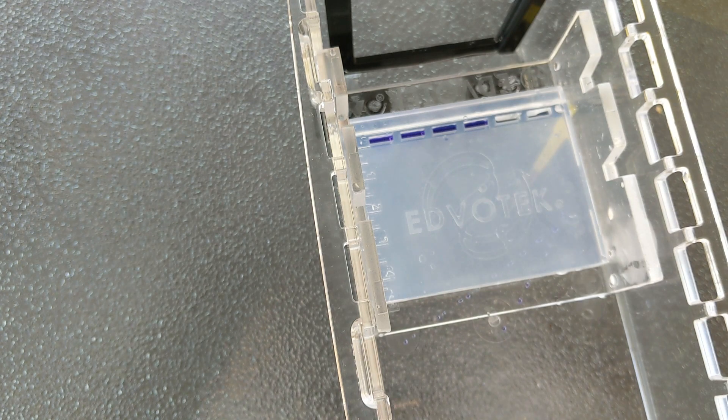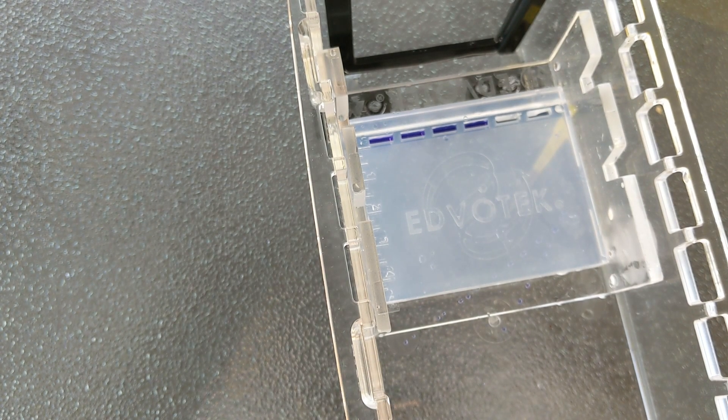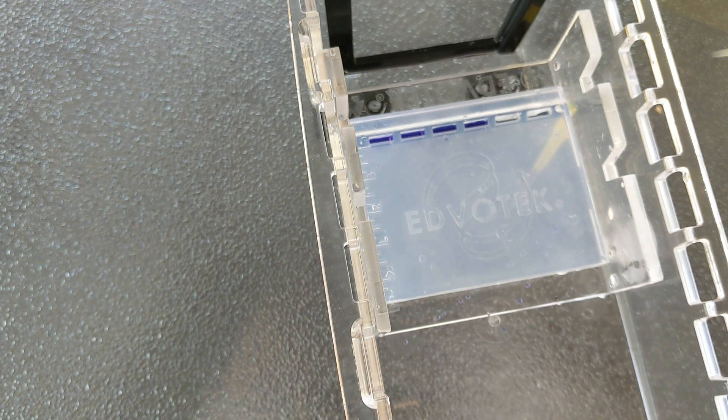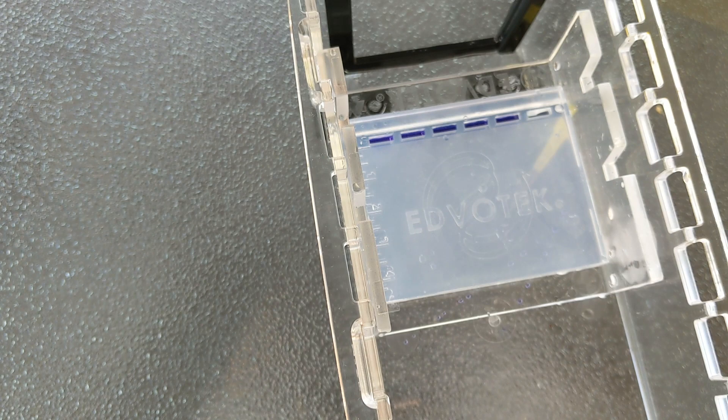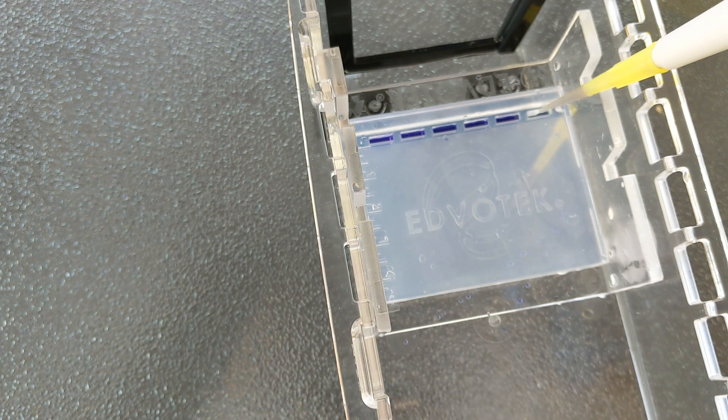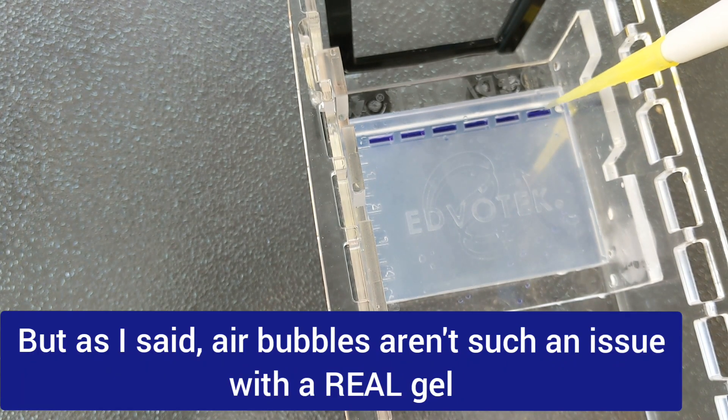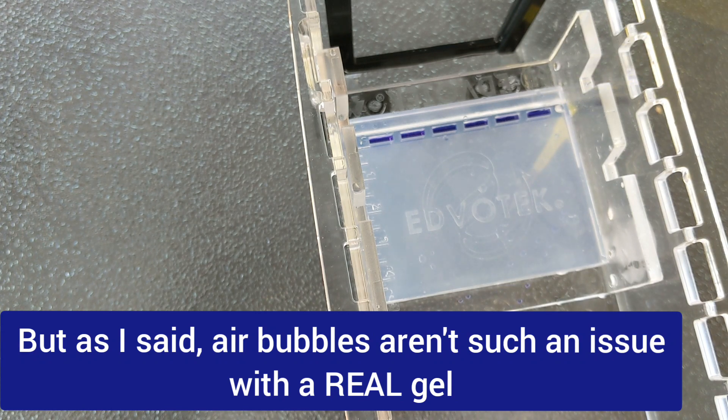The only thing is, we are going to have to add the buffer at some point, and that's when it gets just slightly tricky, but it's still fine. So unlike with the wet load, we're not getting any issues with air bubbles. Our DNA all went in really beautifully. But the trick is, we do still need to add the buffer.